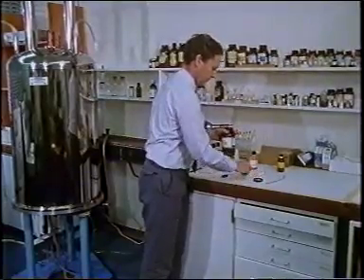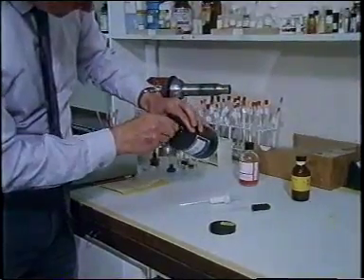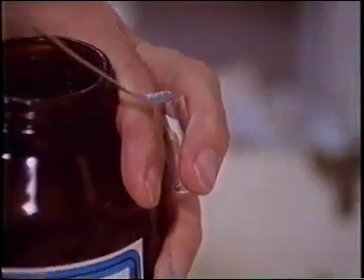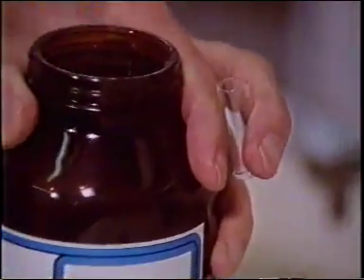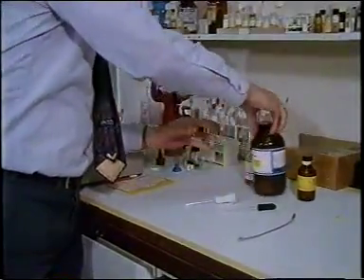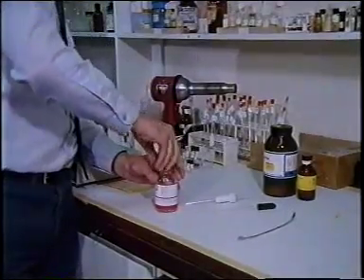Let's take a closer look at sample preparation. Mostly, compounds are examined in solution, often with deuterated chloroform, CDCl3, or D2O as solvent. My colleague, Dr. Oliver Howarth of the NMR Centre at Warwick University, is making up an appropriate solution.